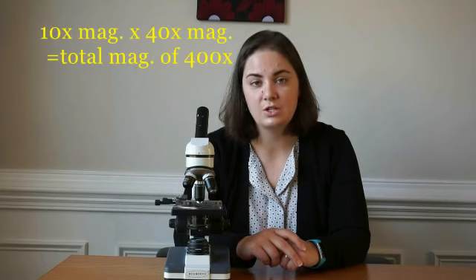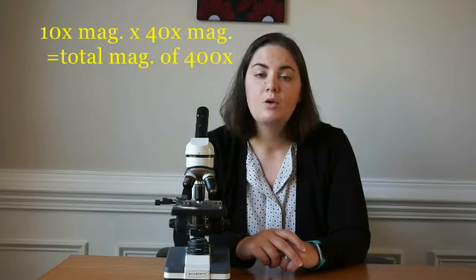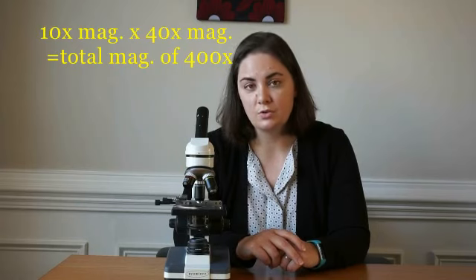The total magnification of a light microscope is calculated by taking the magnification of the eyepiece times the magnification of the objective lens. So for this typical microscope, the eyepiece has 10 times magnification and the objective lens has 40 times magnification, giving us a total magnification of 400 times. Most typical light microscopes for high school courses have 3 objective lenses, ranging from 4 times to 100 times magnification, giving the total light microscope magnification somewhere around 1,000 times.